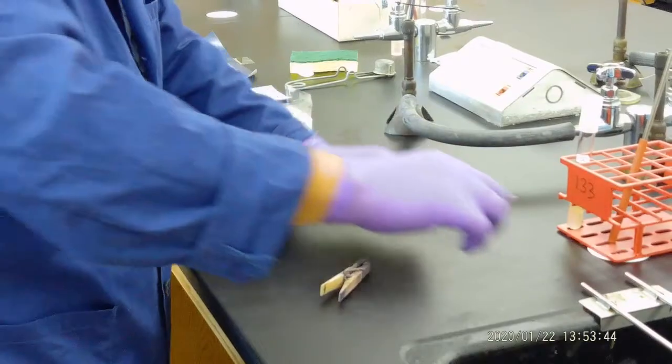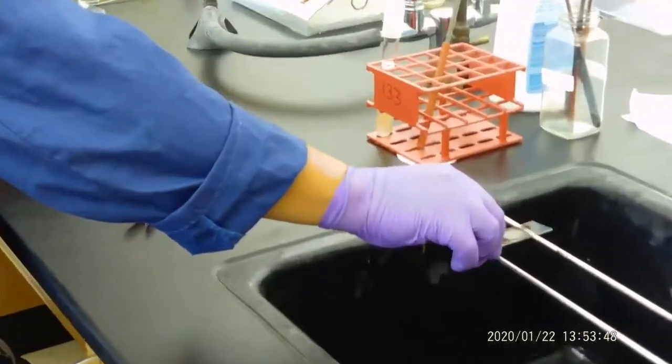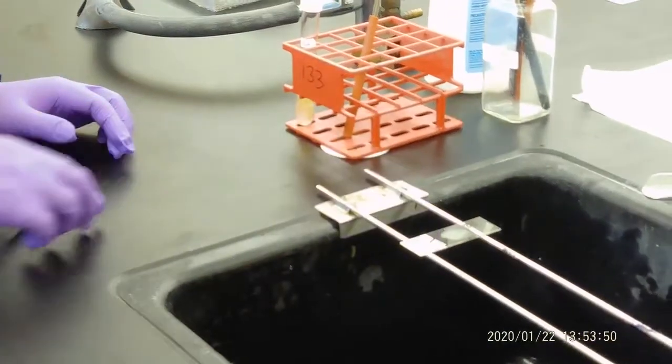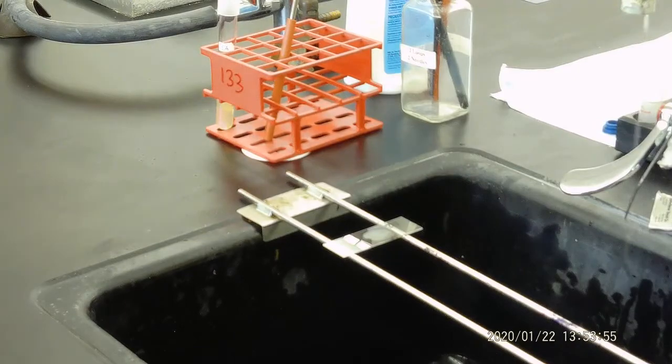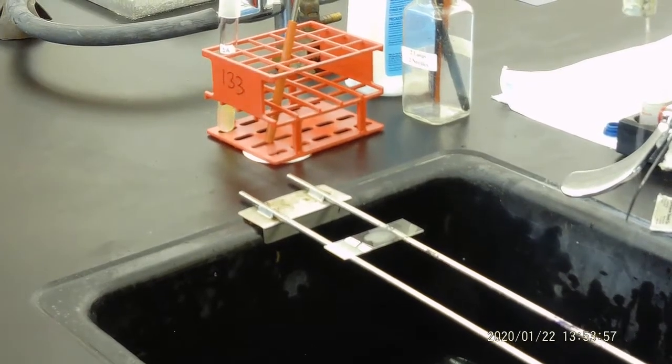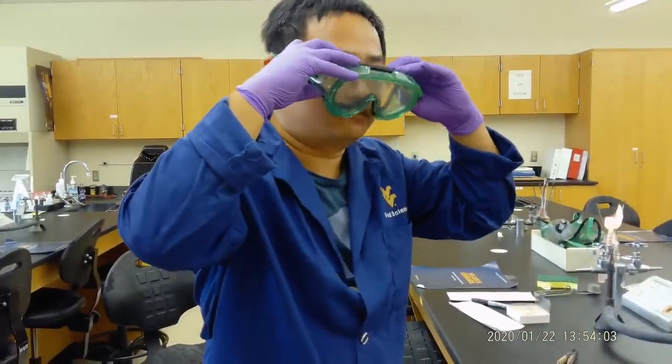Then we move the glass slide into the basin on the rack here. At this moment, the very important procedure you need to know and don't forget is wear a goggle, because we are going to be using a dye. So we have to wear a goggle.